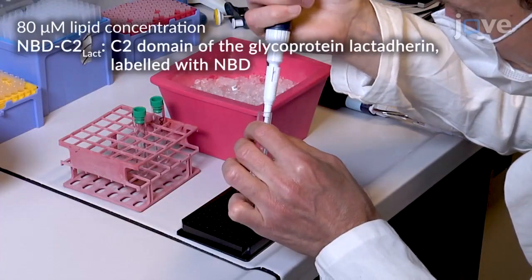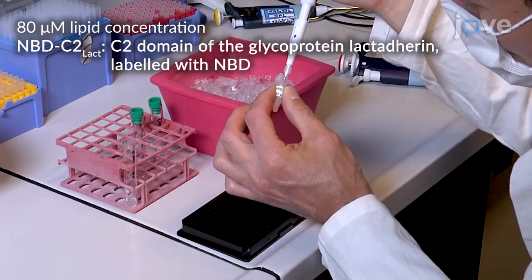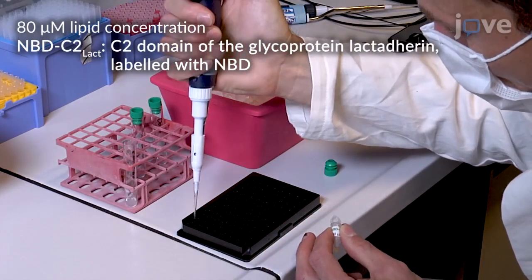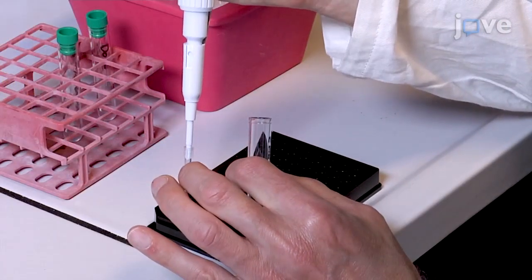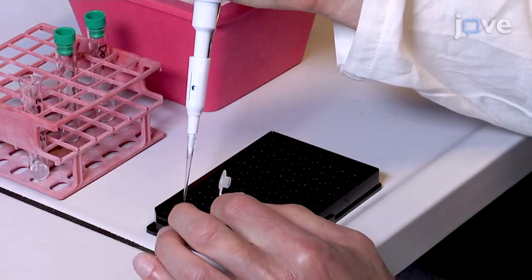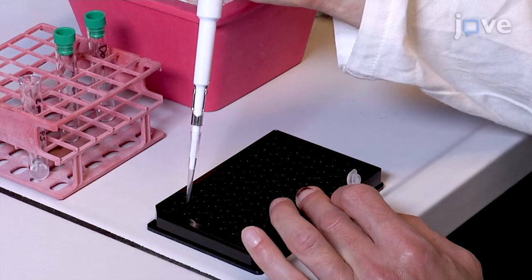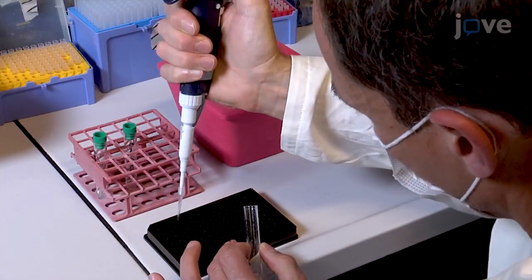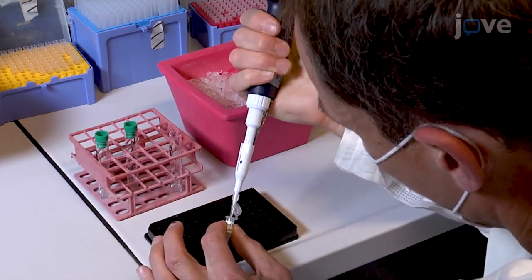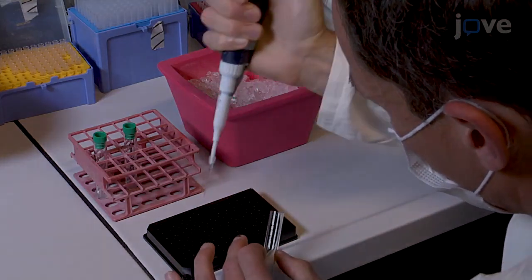In one well, mix liposomes containing 2 molar % PS with lipid sensor NBD-C2 lact to a final concentration of 250 nanomolar in a volume of 100 microliters. Fill a second well with the same amount of liposome and NBD-C2 lact mixed with 3 micromolar lipid transfer protein, or LTP. Fill a third well with 250 nanomolar NBD-C2 lact mixed with pure 80 micromolar PC liposomes and a fourth well with pure 80 micromolar PC liposomes.